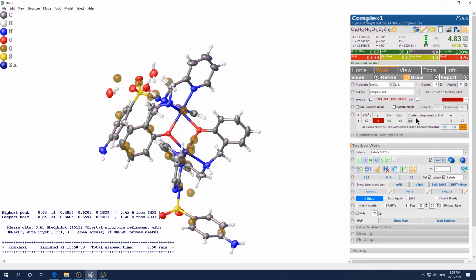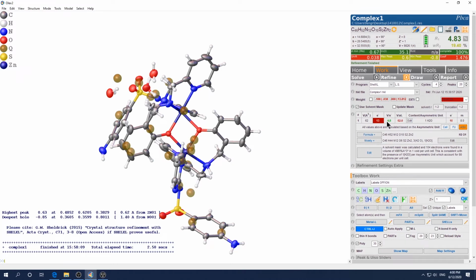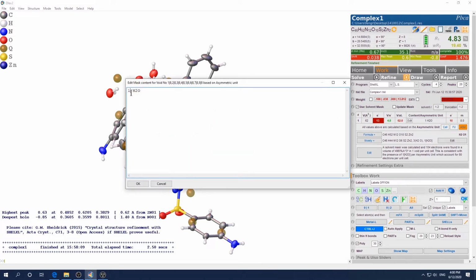So if you click the edit on the contents in the asymmetric unit, click edit, then you just put the type of solvent. You don't need to put the number, just put the identity of the solvent, like H2O. If it's methanol, you just put a methanol or the formula of the methanol and click OK. Then now you can see that the program automatically calculated it is close to 1 water, but it's only 10 electrons. Doesn't match that 13. So what you're going to do is come back here and change it to 1.3. So we just click OK.